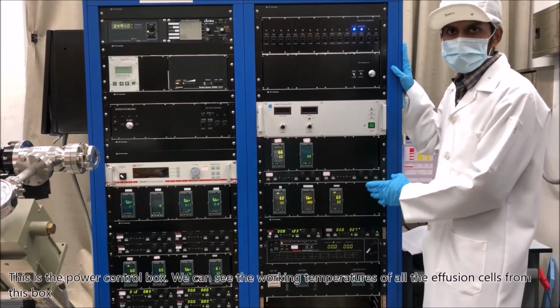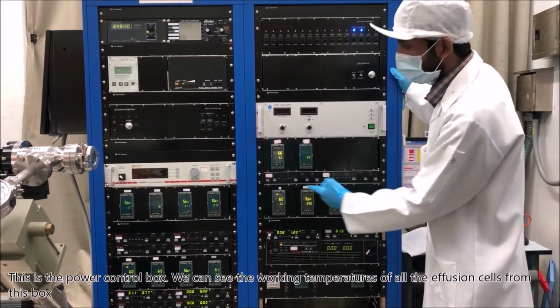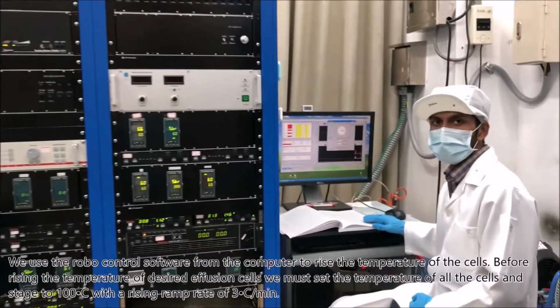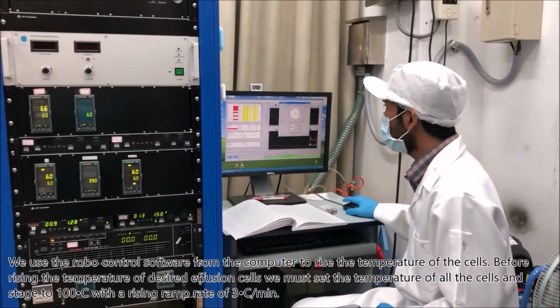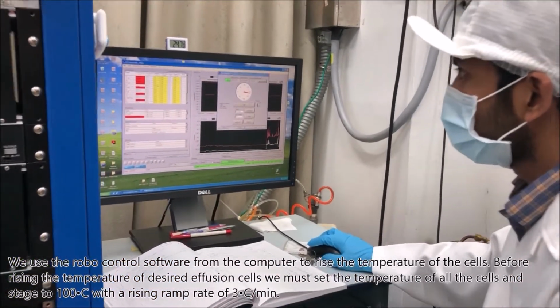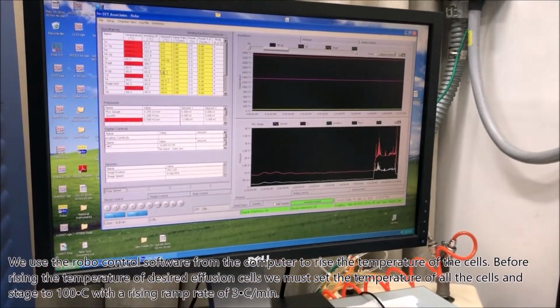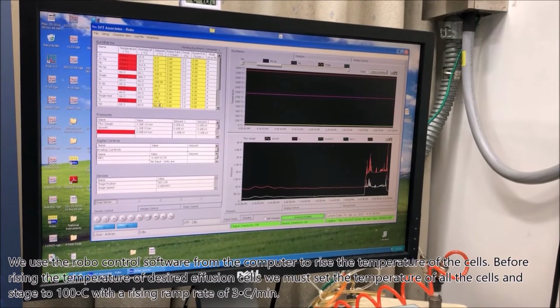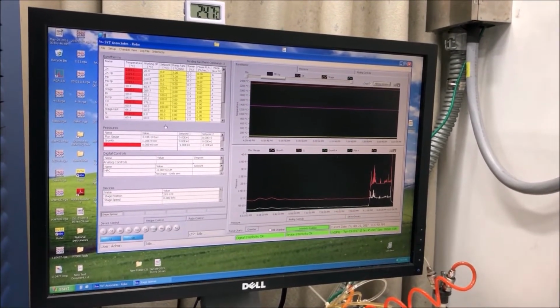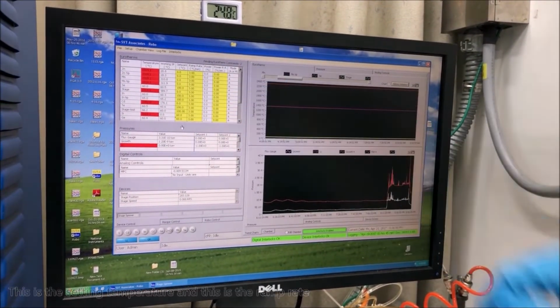This is the power control box. We can see the working temperatures of all the effusion cells from this box. We use the robo control software from the computer to raise the temperature of the cells. Before raising the temperature of desired effusion cells, we must set the temperature of all the cells and stage to 100 degrees with a raising ramp rate of 3 degrees per minute. This is the setting temperature and this is the ramp rate.